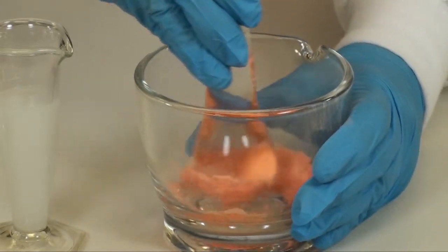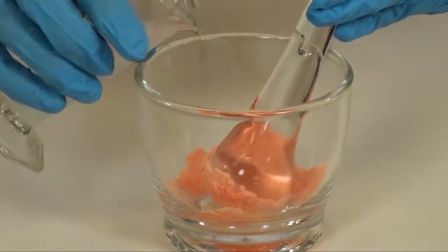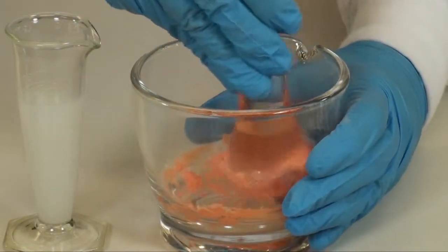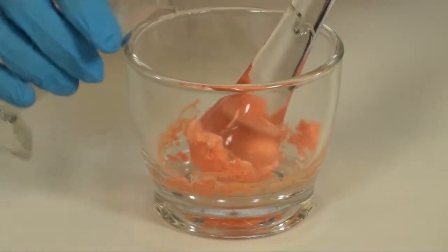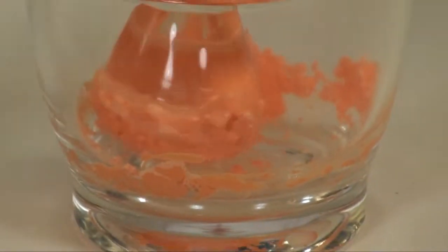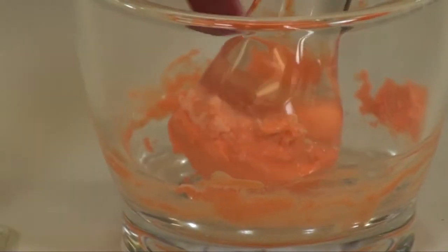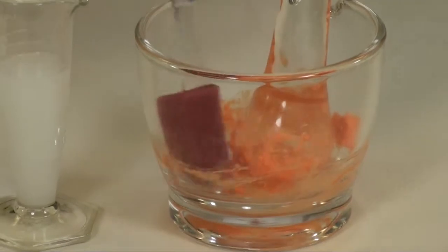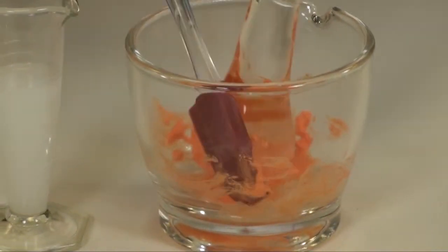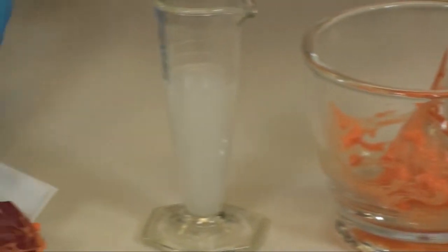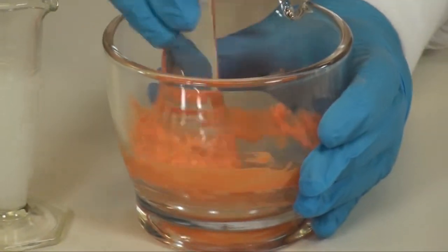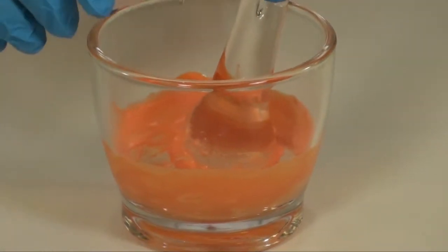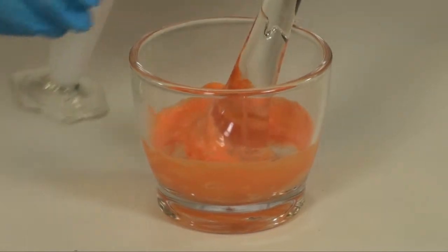Try to work with your drug and the suspending agent in the bottom of your mortar. Scrape down the drug off the pestle from time to time. Scrape the sides to keep the drug down at the bottom. You can use a weigh boat and place your dirty spatula so you don't lose drug. Continue to add small amounts of ORA Plus until you have a smooth slurry with no lumps.